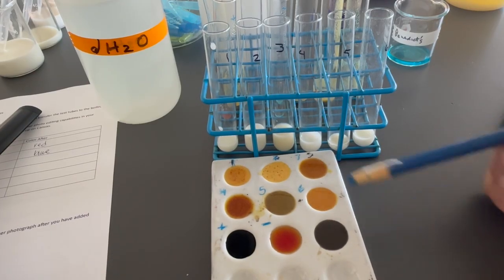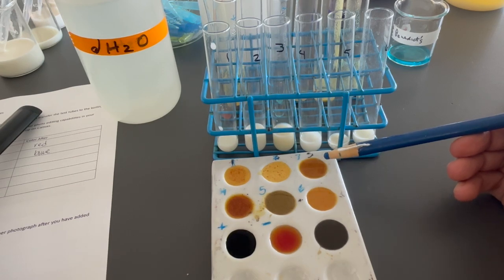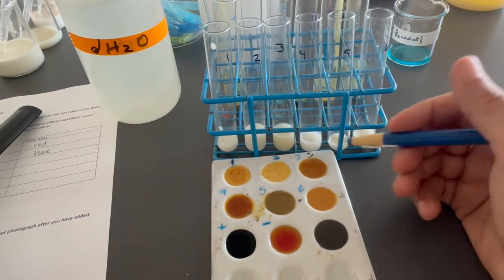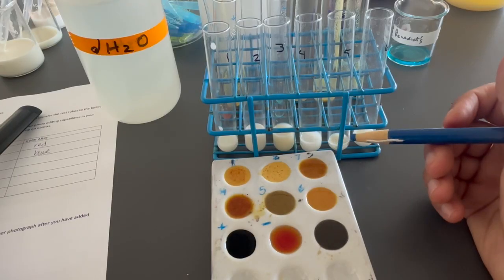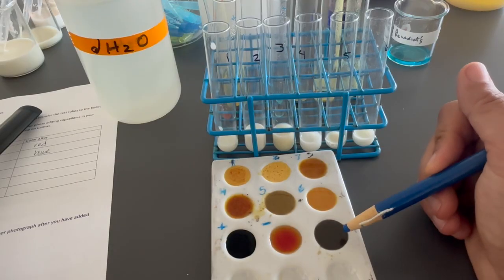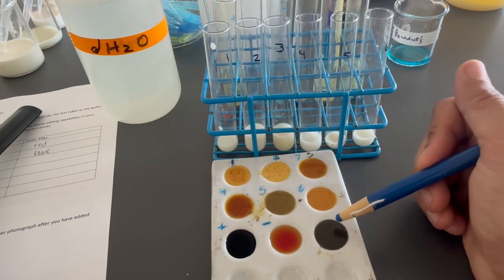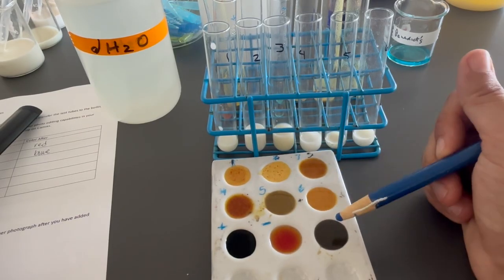I'm not sure what's going on with this brand of oat milk. I think maybe it is sweetened oat milk and the sugars in the solution maybe are not providing an environment for the starch and the iodine to bind, as iodine binds to those coiled up polysaccharides. So here we have what the oat milk or sample 3 should look like. And we may have varying results on the different campuses.